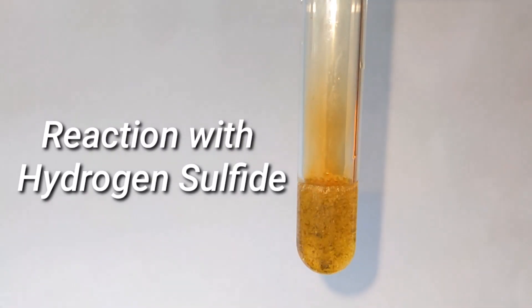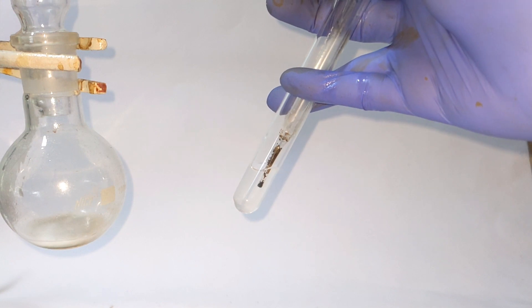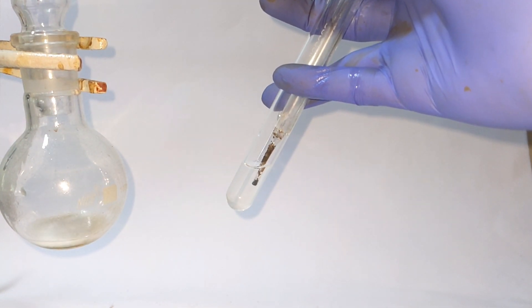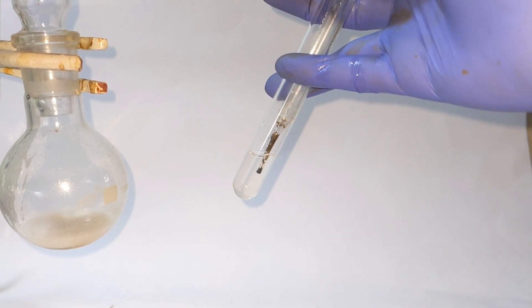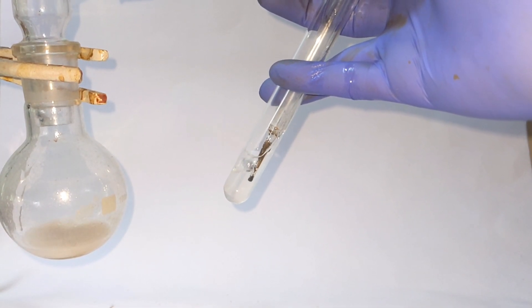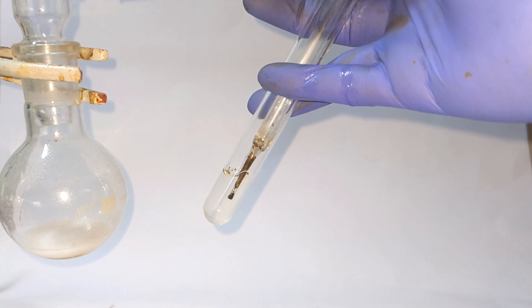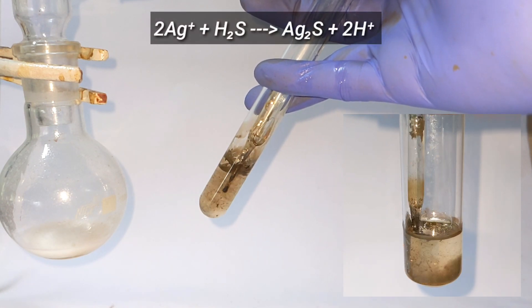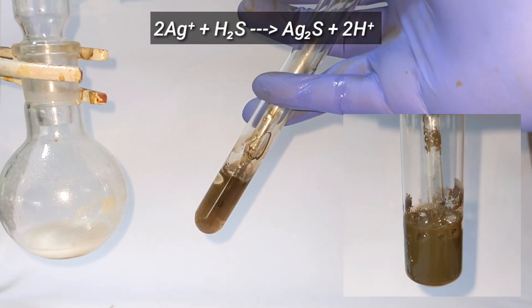Next we move on to the reaction with hydrogen sulfide gas. In the test tube we have the silver nitrate solution, and in the round-bottom flask hydrogen sulfide gas is being generated by the addition of hydrochloric acid to sodium sulfide. You immediately see the bubbles of hydrogen sulfide passing through the test tube, and you see the formation of a black colored precipitate — this is silver sulfide.